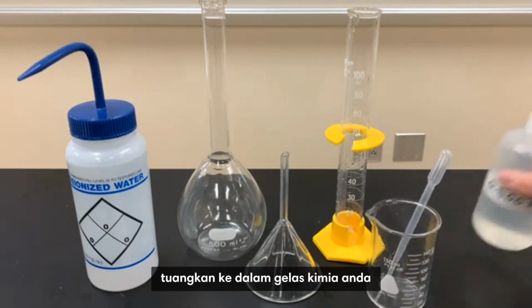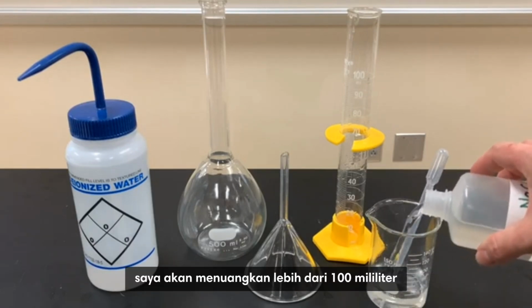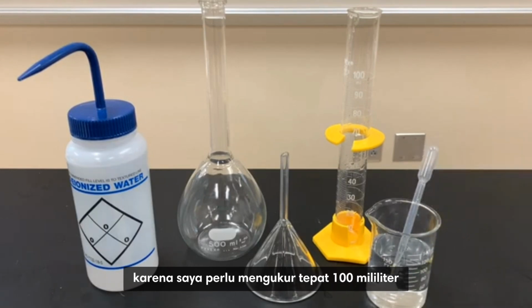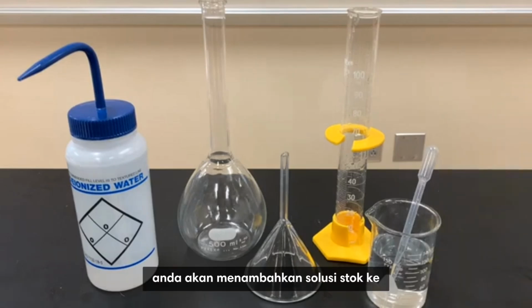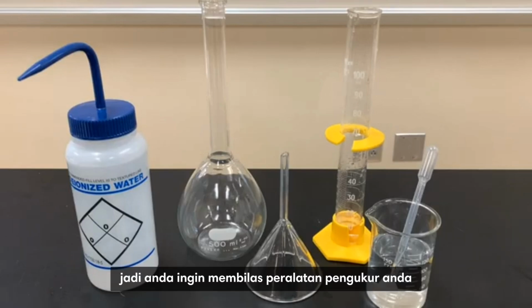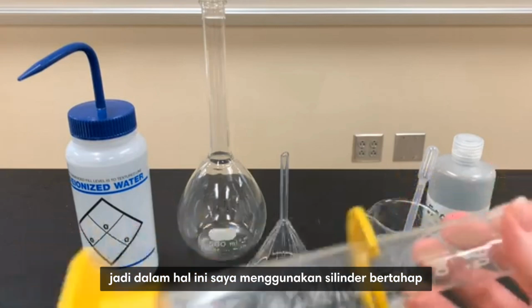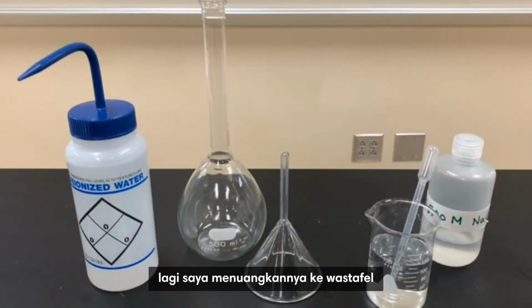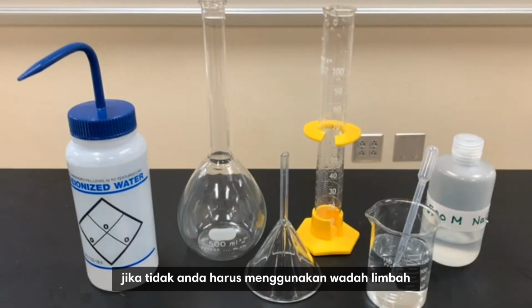Next, pour into your beaker more than the volume you're going to measure. So for example, for me, I'm going to pour in over 100 milliliters because I need to measure exactly 100 milliliters. Next, you'll add the stock solution into the piece of equipment that you're going to be using to measure. So you'll want to rinse your measuring equipment also with that stock solution. In this case, I'm using the graduated cylinder, which is the most common piece that you'd have in a chemistry lab. Again, I poured that into the sink because that is a safe solution. If not, you'd have to use a waste container.